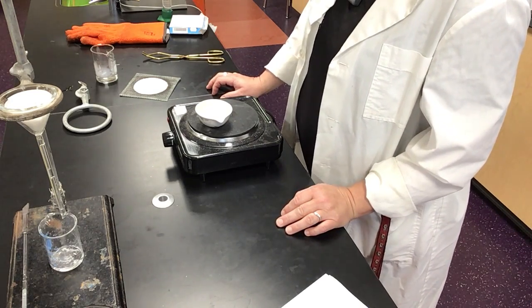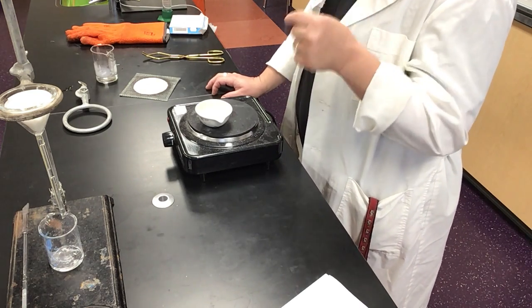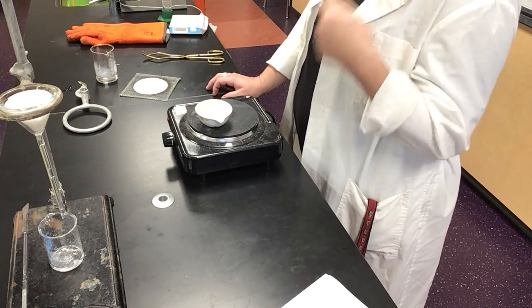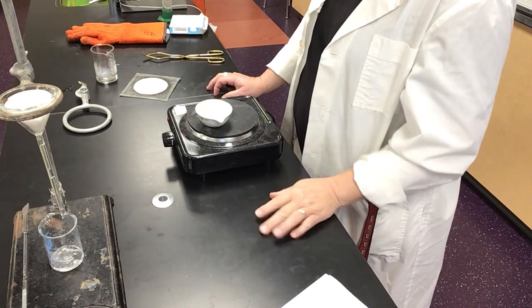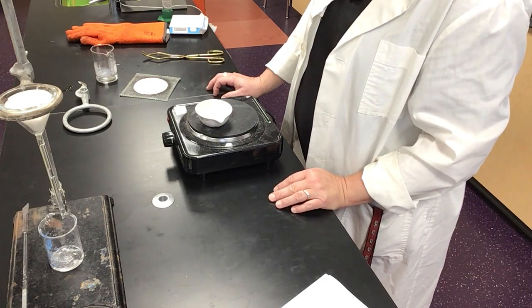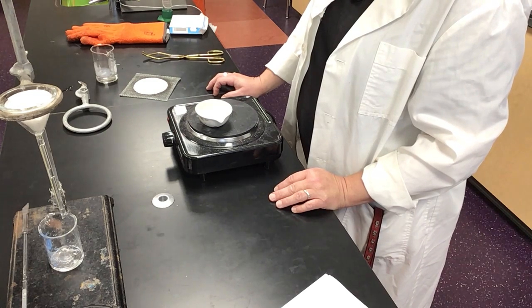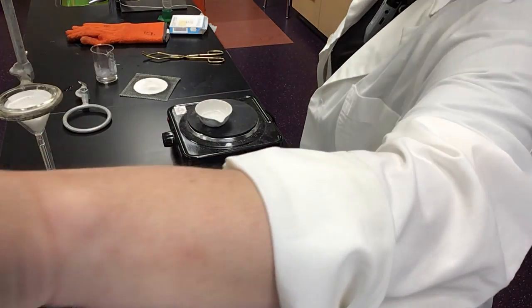Well, still boiling. Ideally, when you're boiling off a filtrate, you want to see small bubbles periodically. You don't want to see the kind of rolling boil that you would want in a pasta pot at home, okay? Even on low, it's taken the burner long enough to come down that it's going to continue to eject material for a while. Yeah, we're getting fat chunks of salt, so. Okay, I'll stop that video. That's what not to do when boiling off a filtrate.